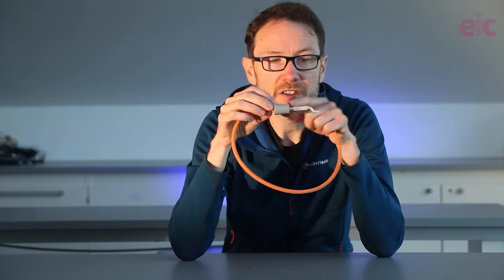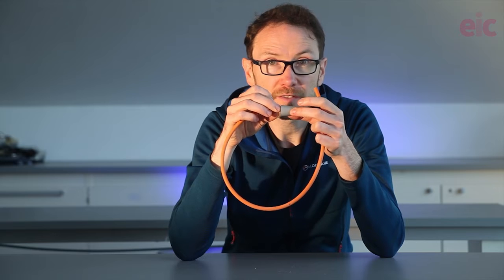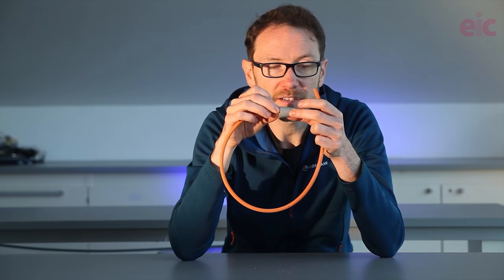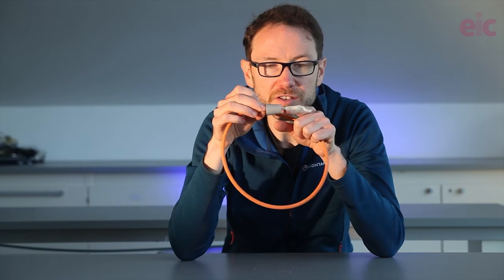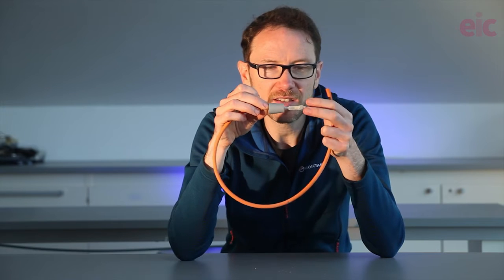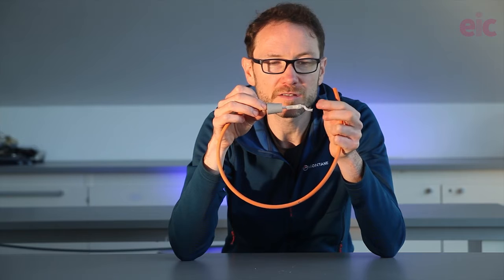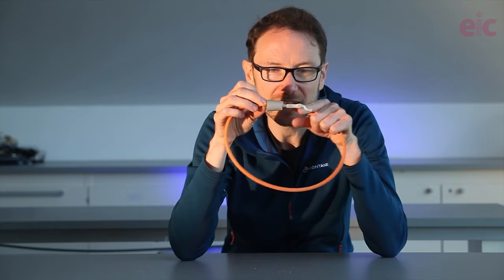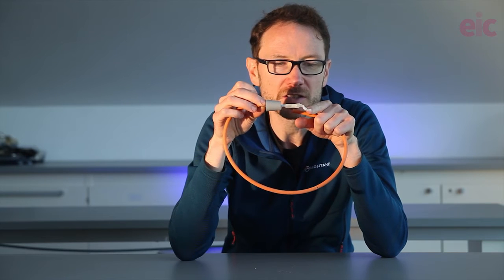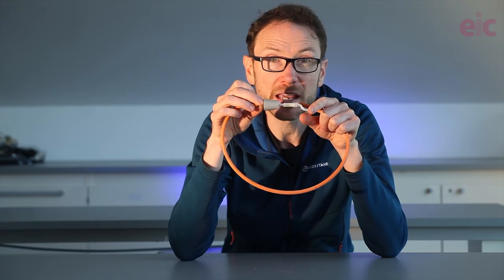Cleaps recommend threading a tube through a rubber stopper and using the stopper to hold it against the side of the coffee tin. Technically you could just feed the tube directly into the base of the coffee tin, but the more pieces that can move during the demonstration the less reliable it will be in front of the class. So I've made a little attachment here which bends onto the bottom and makes sure that the puff of air is delivered to the base of the powder.